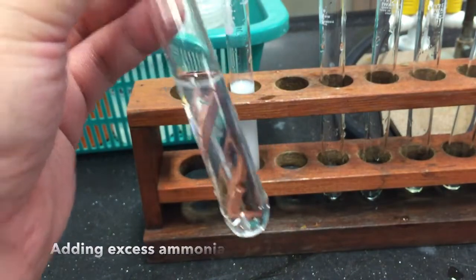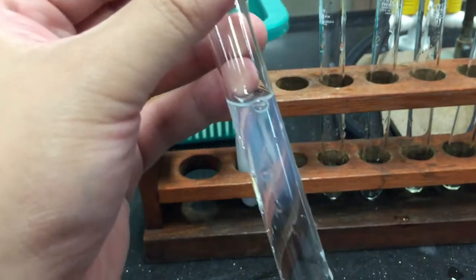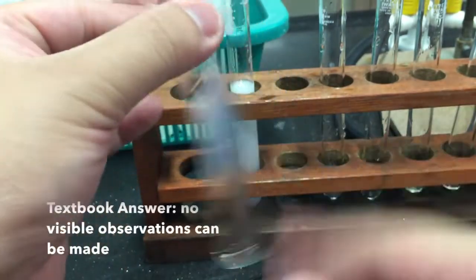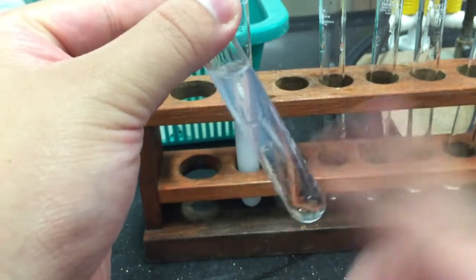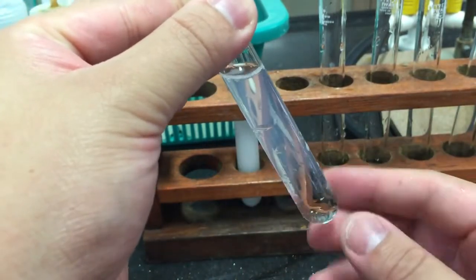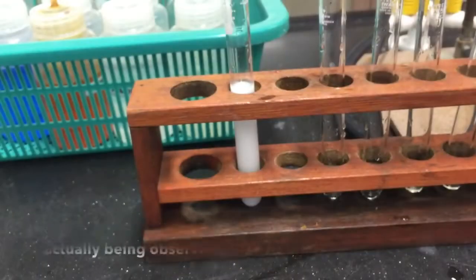Even when we add excess ammonia, the textbook insists that no visible observations can be made. Is this really true? Well, let's try that again.